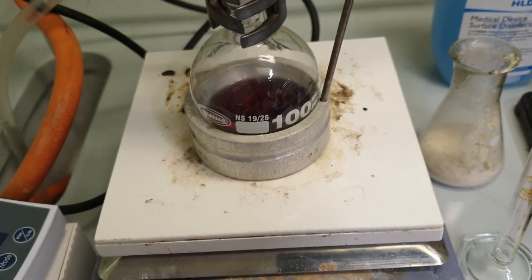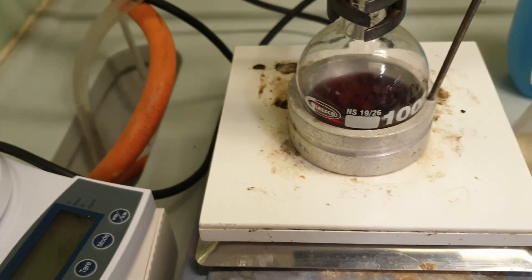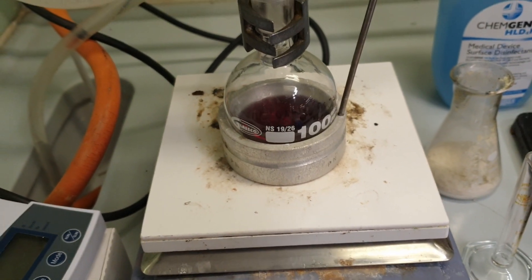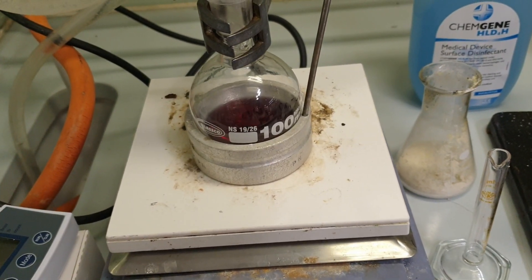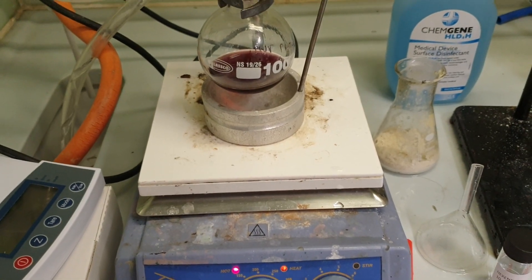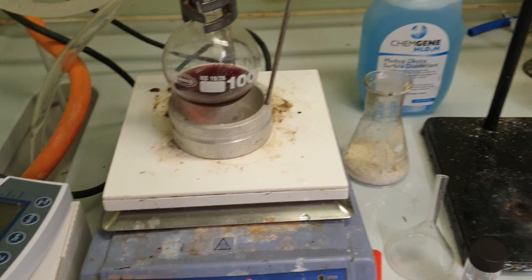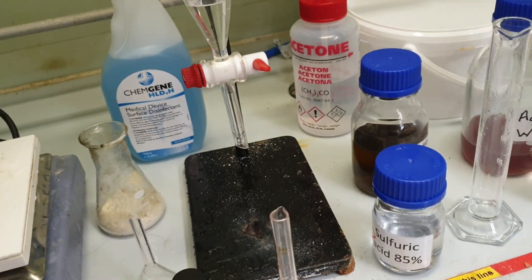I think here I was thinking that this was happening due to a high temperature. Although technically when you get a dark black or dark color with carbon it's generally because you oxidized the carbon, which is synonymous with burning the carbon. So technically burned is correct.